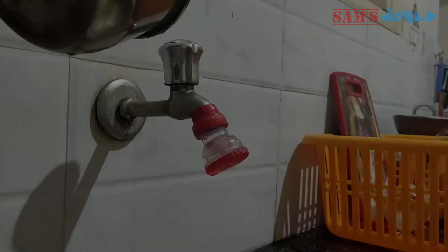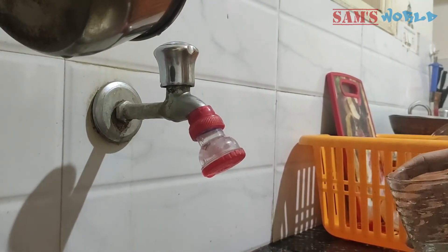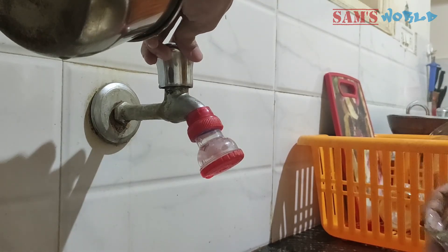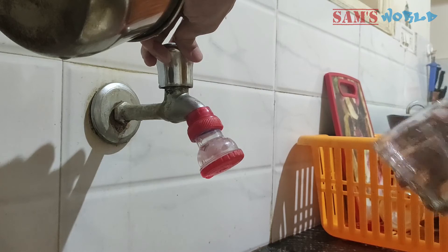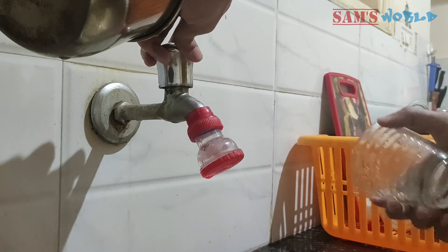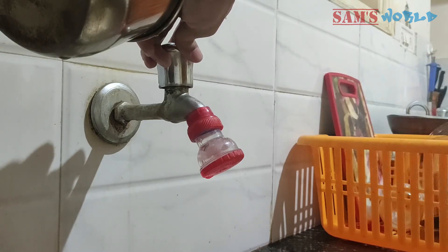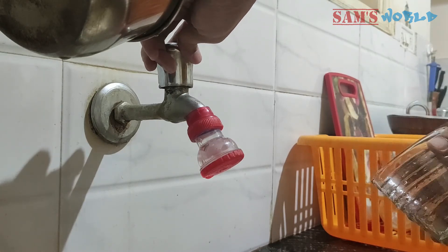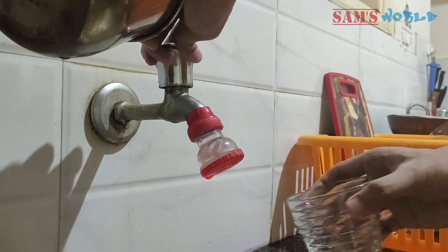Now that we know what TDS is and its impact on our drinking water, let's have a quick demo where I will show you how to measure the TDS level of water with this instrument. Since I am based in Bangalore, we have a Cauvery water connection at home and use this water to wash utensils and vegetables, but for drinking we use can water. I will compare tap water and can water for the TDS level. Let's get some tap water in a glass.